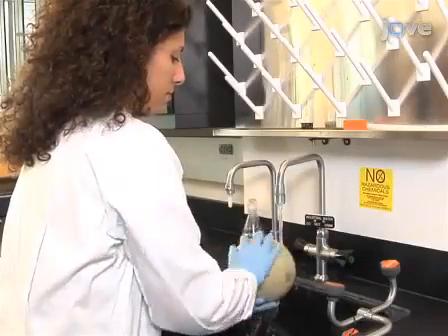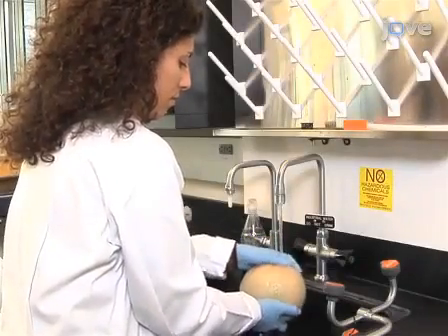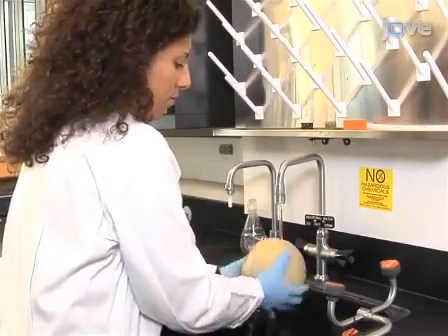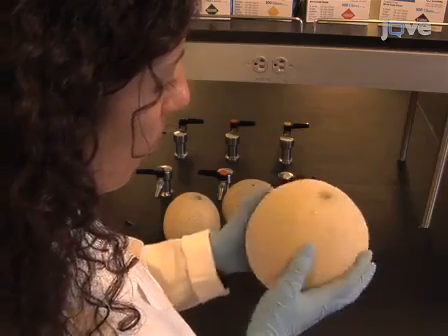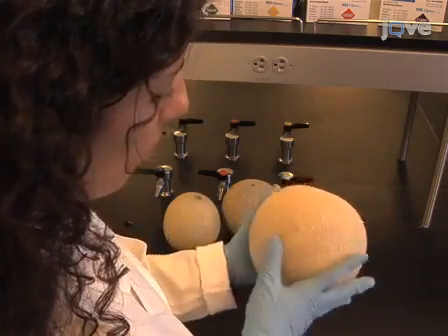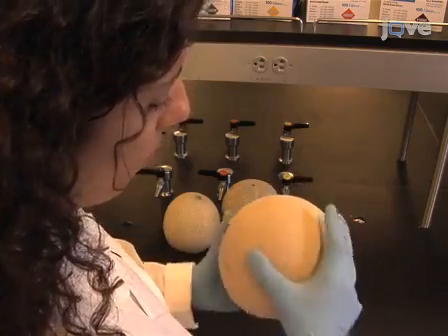After harvesting fruits at the desired maturity stage, rinse with tap water in order to remove dirt and dust. Select fruits for analysis based on the absence of external and internal defects and size homogeneity.